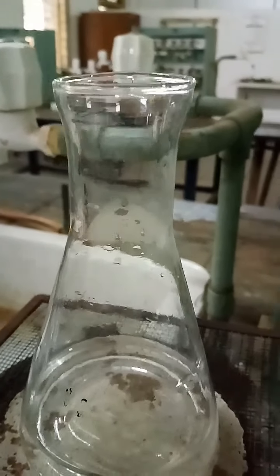So now, immediately titrate this hot solution against KMnO4 solution. Here we are not using any indicator because KMnO4 acts as a self-indicator.